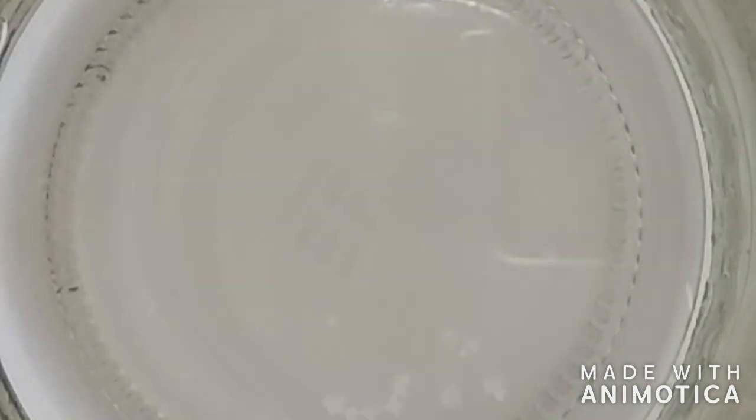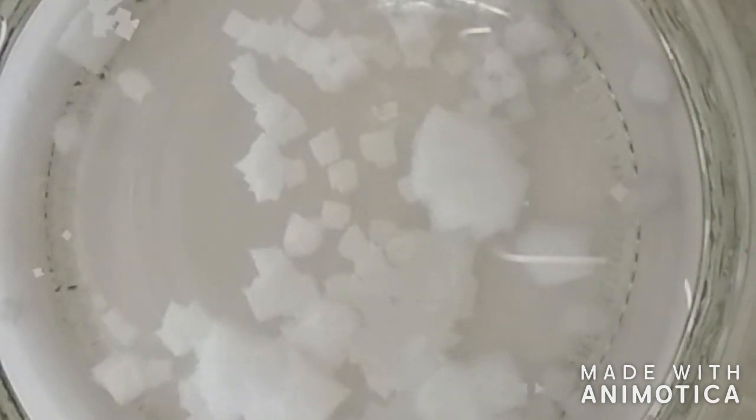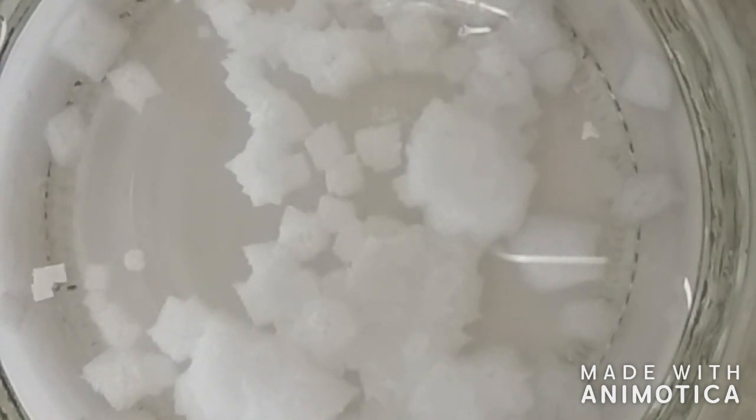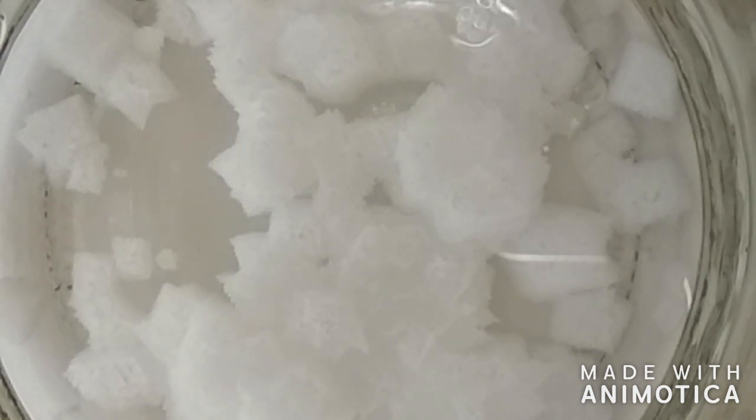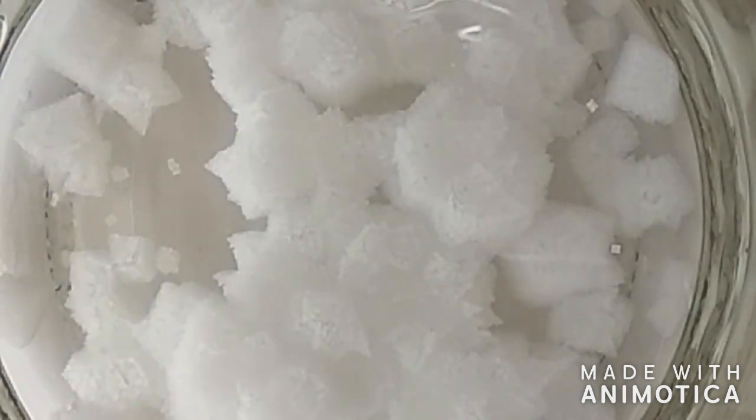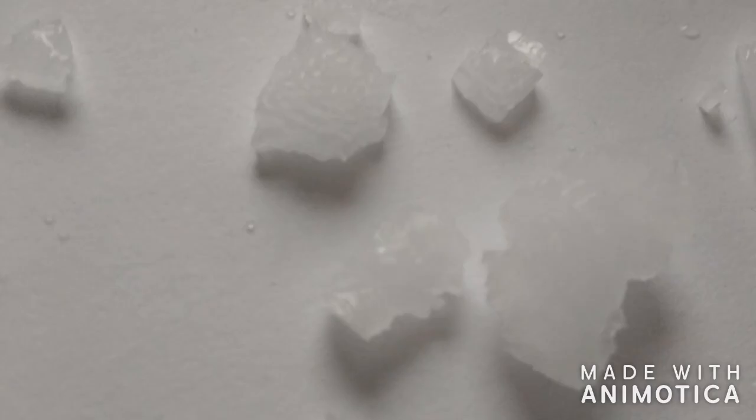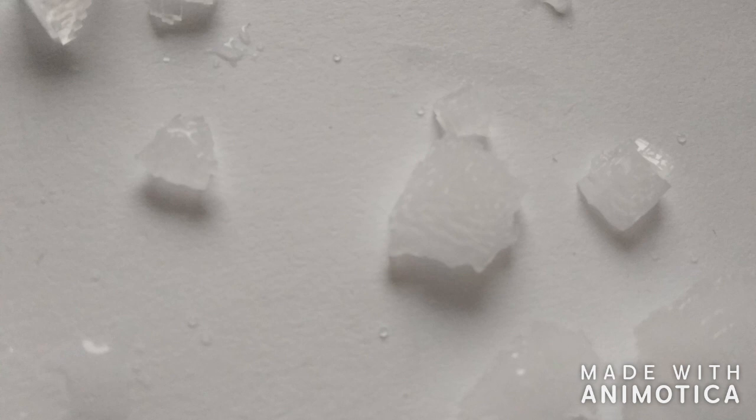So after filtering this is what we have. We just need to do a simple recrystallization. These were my crystals as we can see here. These crystals are quite interesting and are composed of tiny small rectangles.